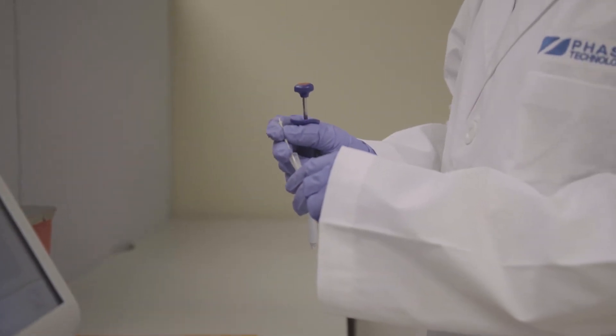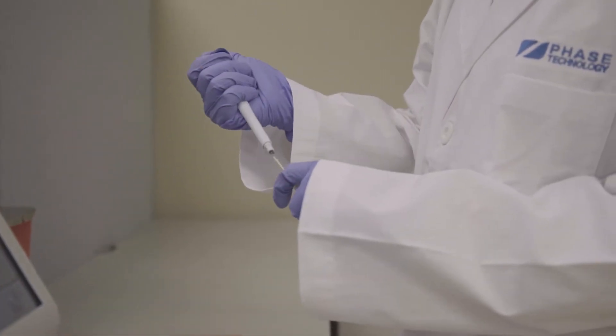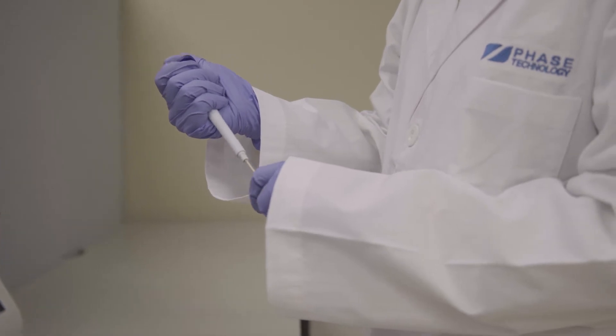Press to fit a new clean tip onto the pipette. Ensure that it fits tightly with no gap between the tip and the pipette body.